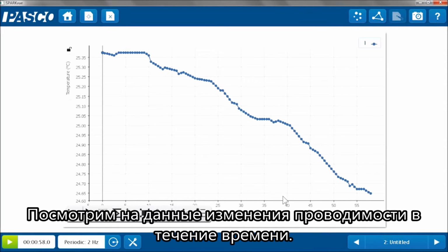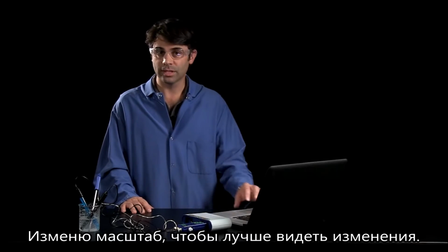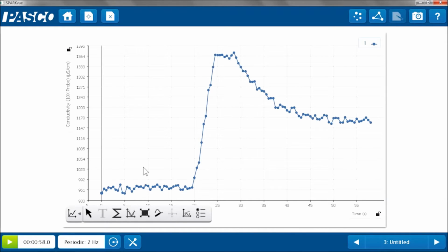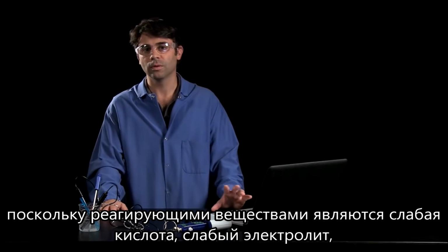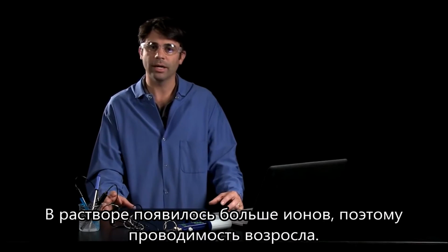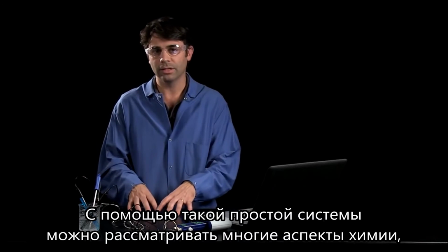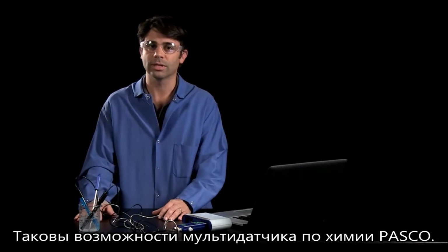So we'll go to the conductivity page. Now we have conductivity versus time. Again, we'll auto-scale this so we can get a better look. And the conductivity was low, then it shot way up as the reaction proceeded, because you were reacting a weak acid, which is a weak electrolyte, and you're adding in sodium bicarbonate, and you're producing the CO2 and some sodium acetate. So now I have more ions in solution. So my conductivity increased. You can really get at a lot of the chemistry concepts with a very simple system, as long as you can make all those measurements. And that's what the Advanced Chemistry Sensor allows you to do.